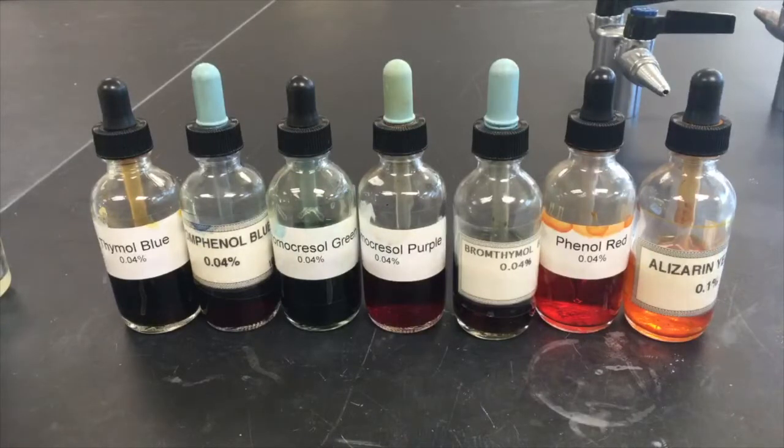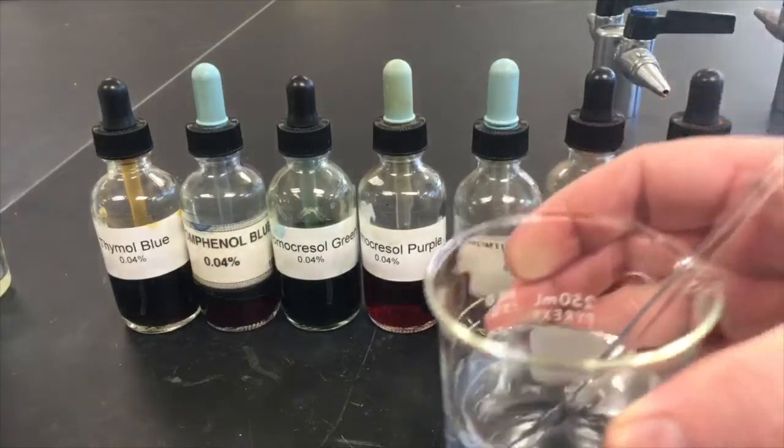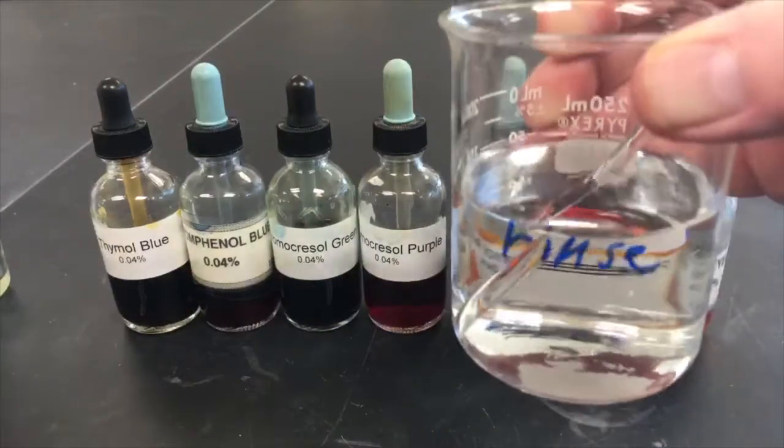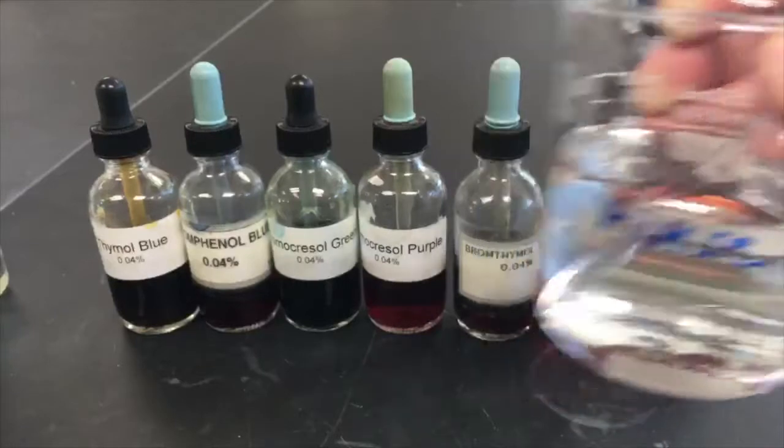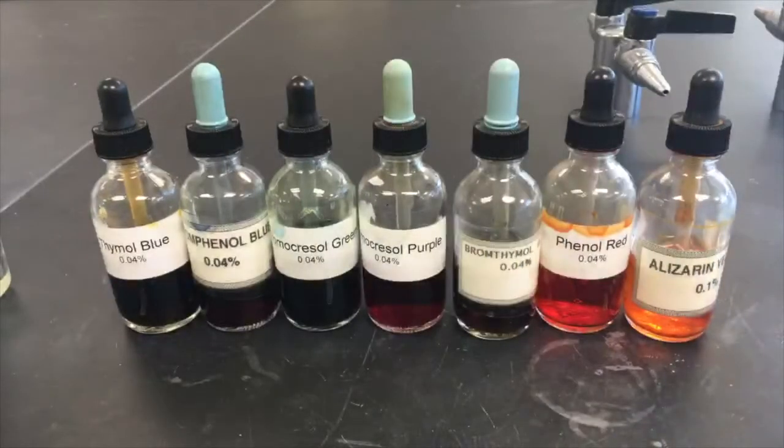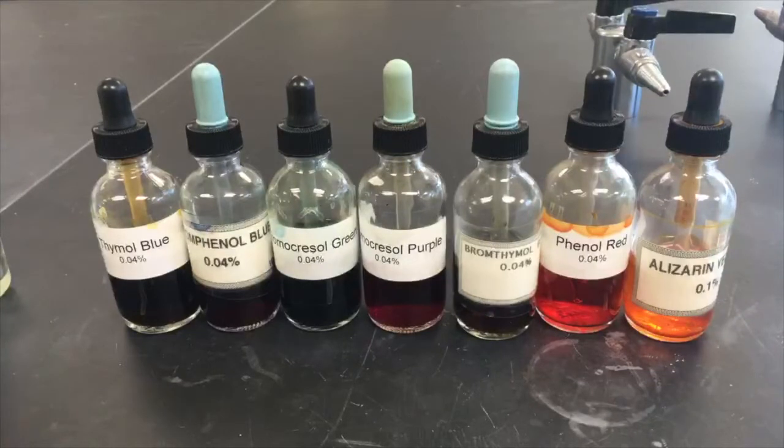Along with that I have a little beaker, it says rinse beaker with a stir bar in it. This is just distilled water and the idea is that I'm going to use that glass rod to mix together the sample and the indicators and I'm going to rinse it off in between the different indicators.